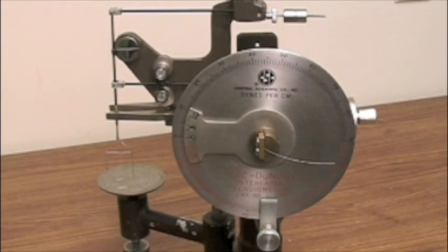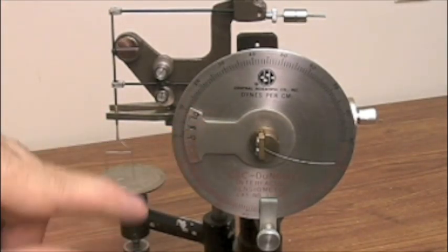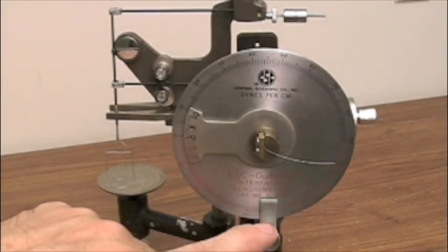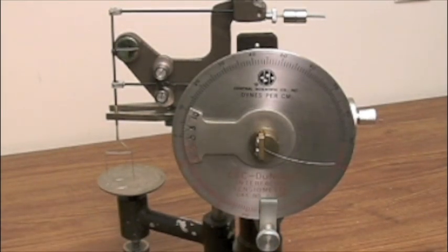At this point we're going to be focusing on the mirror as well as the vernier and the dial and the clamping lock for the dial. One of the first things we do is we want to determine the calibration of the tensiometer.